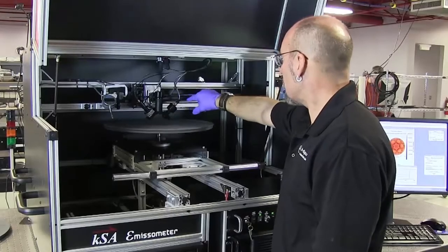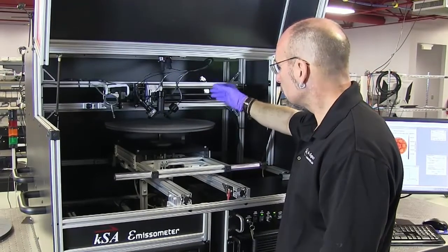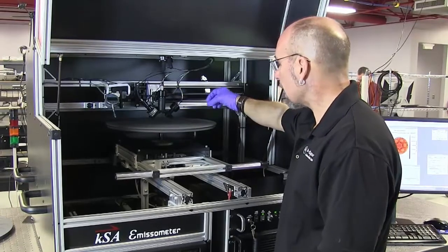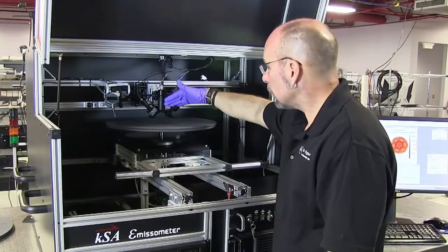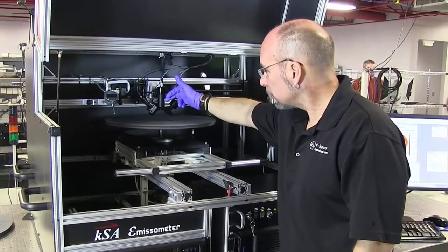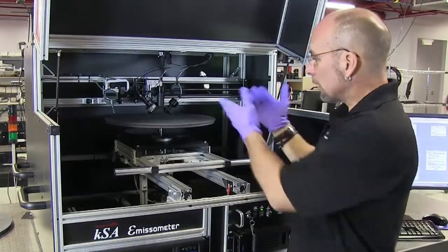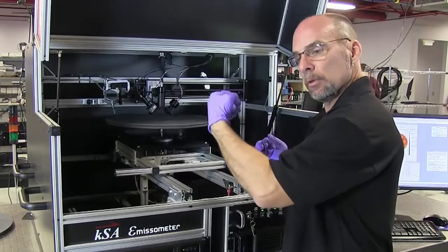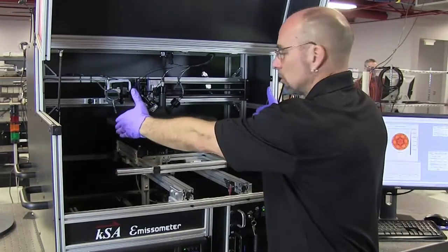The tool is on a linear stage and it scans through the entire carrier radius, starting at radius zero. The user can input the resolution of the radial scan — we move to a radius, take all the azimuthal or angular data, move to the next radius, and so forth. We use a very fast data acquisition board to acquire all three signals — the reference, diffuse reflected, and specular reflected — simultaneously. For a K465i carrier at one millimeter radial resolution, the total scan time is about 10 minutes. For an Epic 700 carrier at 695 millimeter diameter, it takes about 20 minutes.